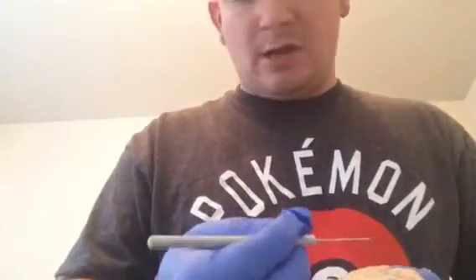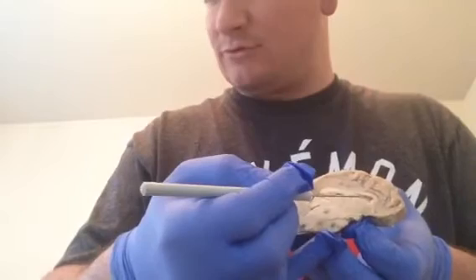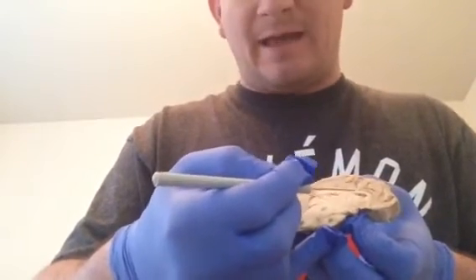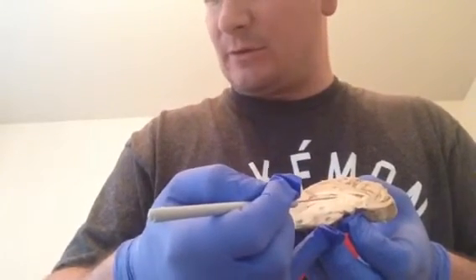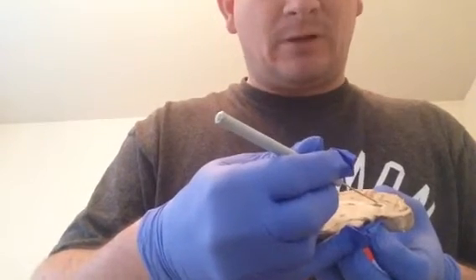Then we go to our mid-sagittal section, mid-sagittal planes, to try and look for some of these inner landmarks. Corpus callosum appears to be the hat of this brain, this white matter here, this cap that goes over it. And that houses our thalamus and then hypothalamus below that. The ventricles here are these divots here that hold the cerebral spinal fluid.